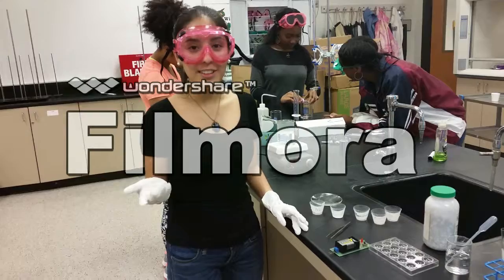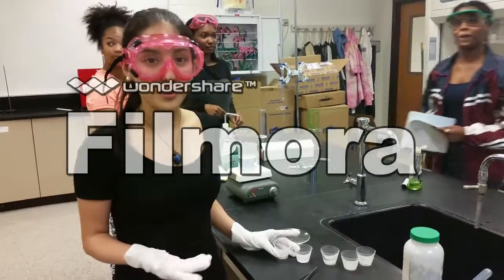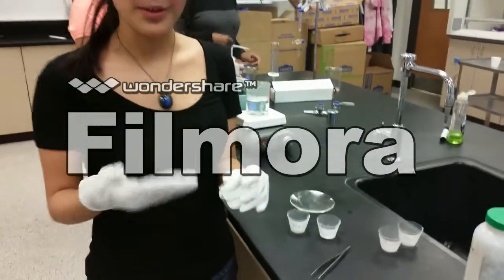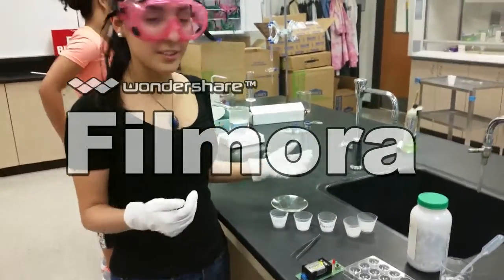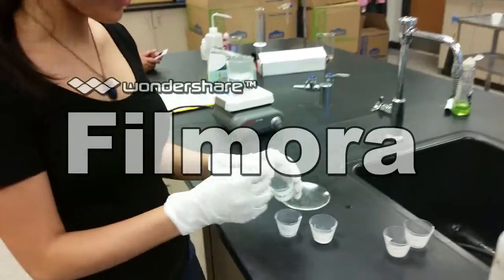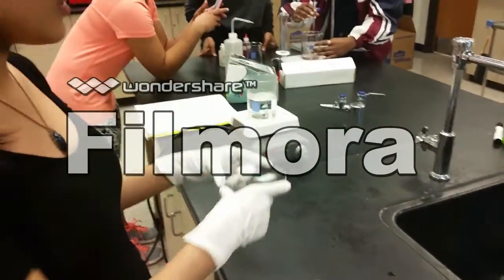The first thing you want to do when starting any lab is putting your safety wear on, so that includes goggles and gloves. You also want to go ahead and start off your sample, so put a small amount of each sample that you will be testing into a weigh cup. You will also want to start off your boiling water bath, which will be used later on in the experiment. So go ahead and note the color and the appearance of each of your solids, and test the odor of each of the solids using a large stock sample and using the wafting technique.